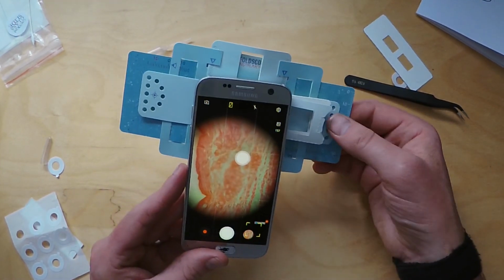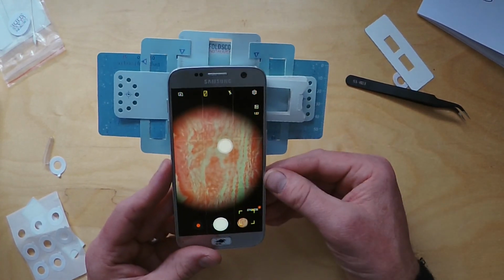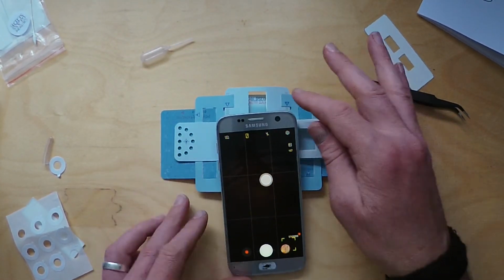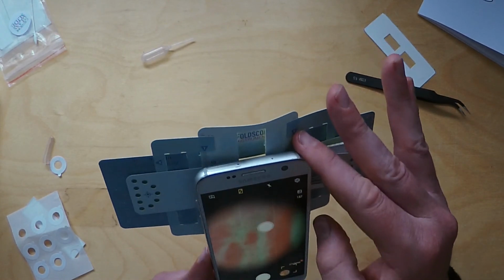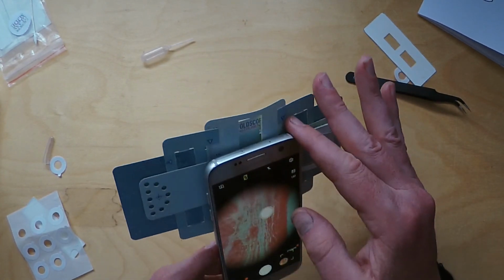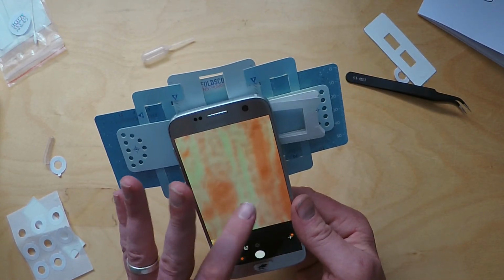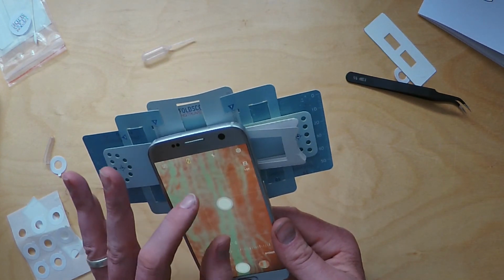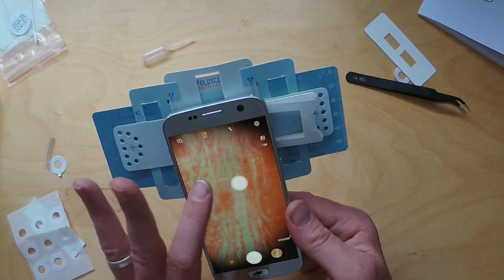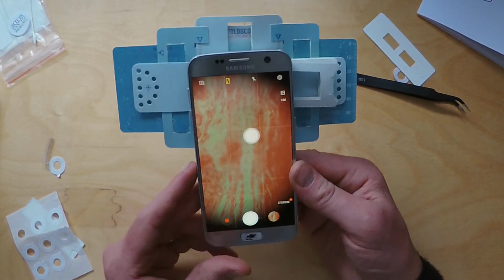So I hope this helps in some way. Obviously, in our sessions together, we'll be able to look into any questions you might have. You want to try different techniques of focus. You see there, as I pushed it in, it's gone out of focus. So I'll pull your ramp out slightly, and there we go, you're in focus. You can zoom in as well with your phone depending on how fancy it is. Mine's not very fancy, and in fact you could see there that I have put a finger mark over my slide, and that's why it's slightly out of focus in the middle. But there you go, I think that's a good start.